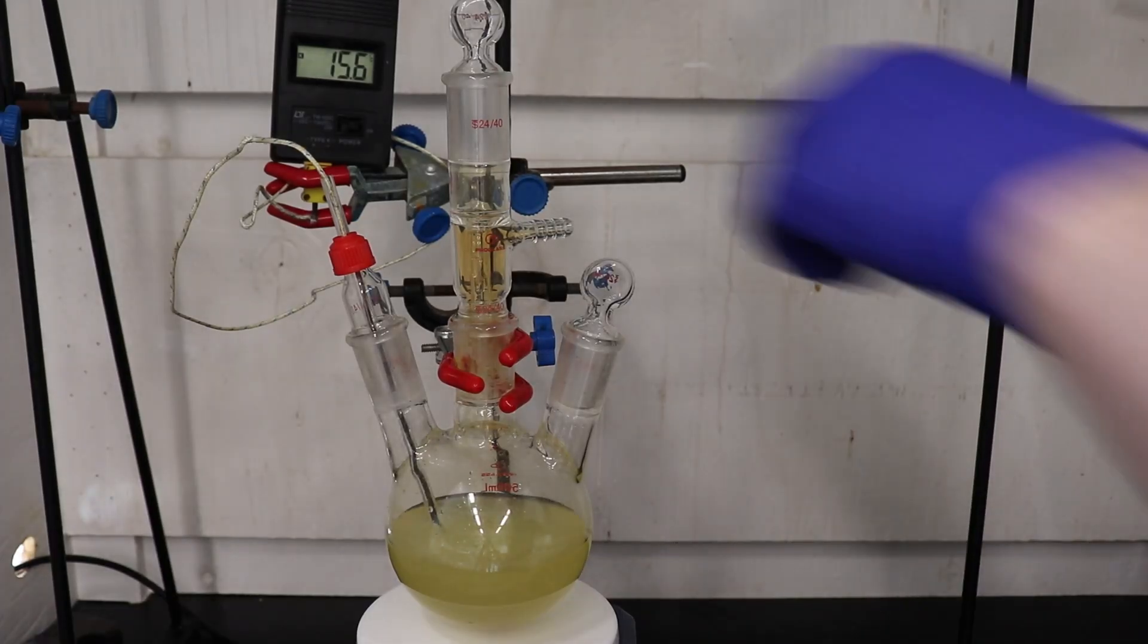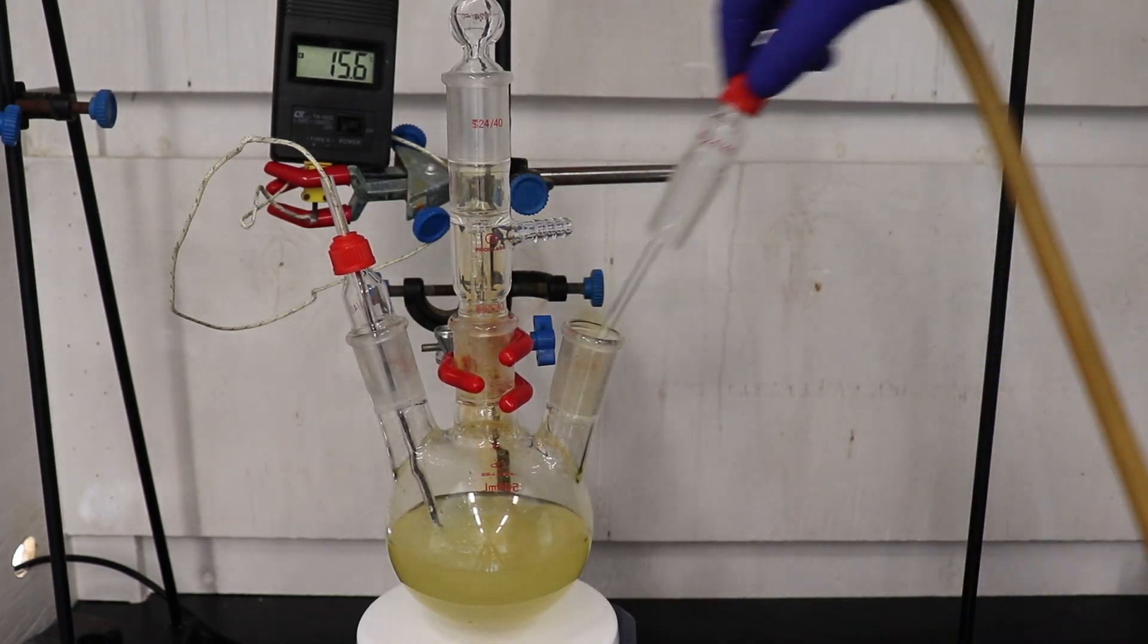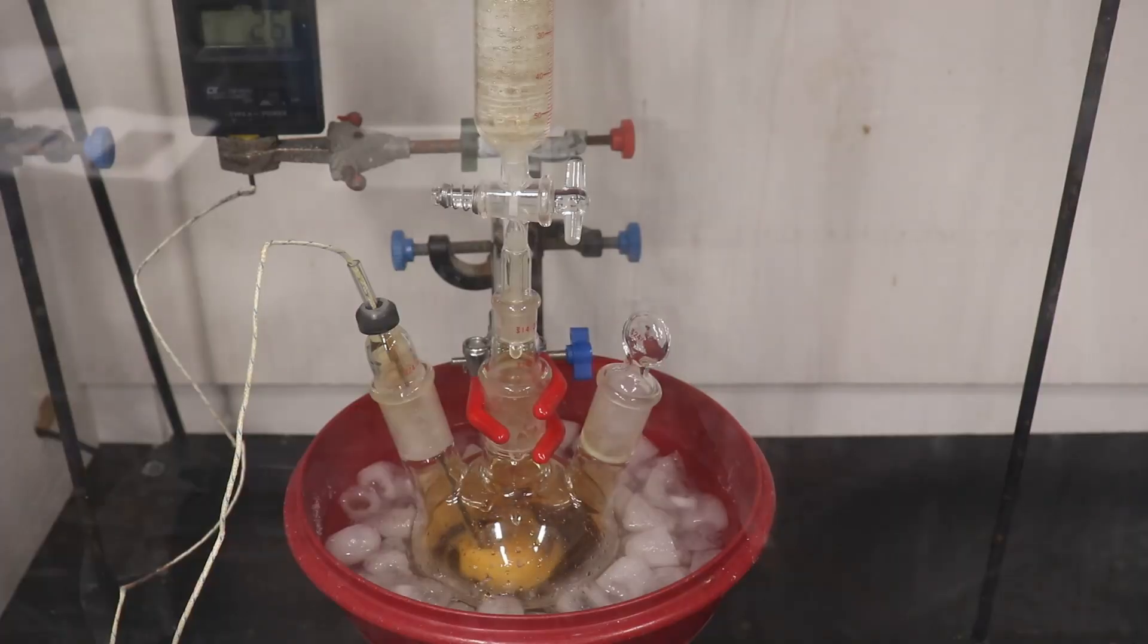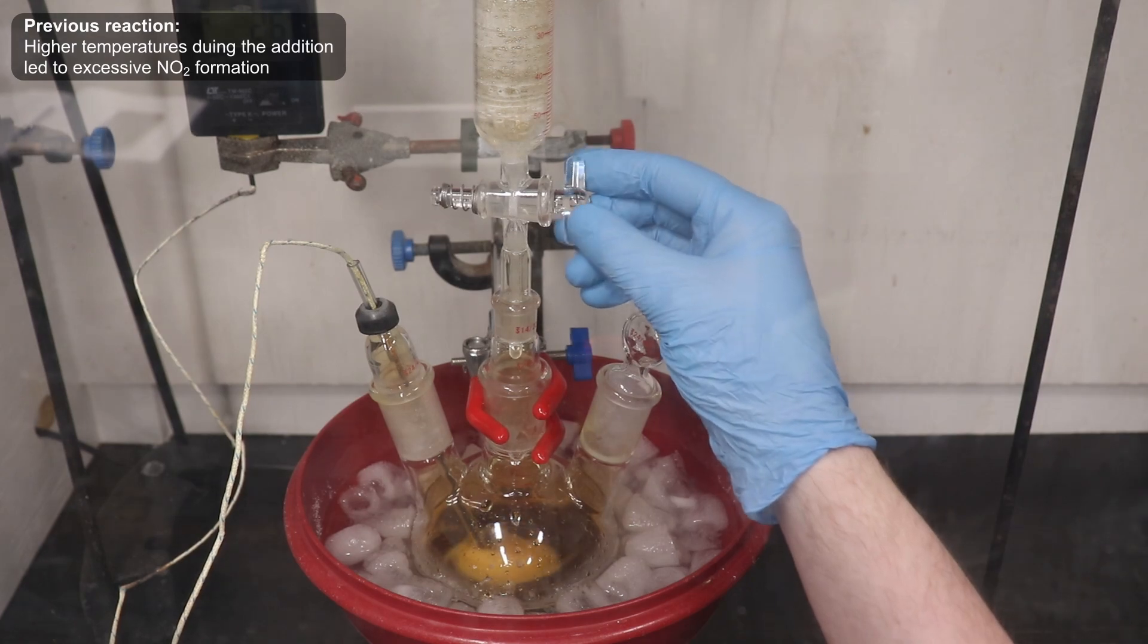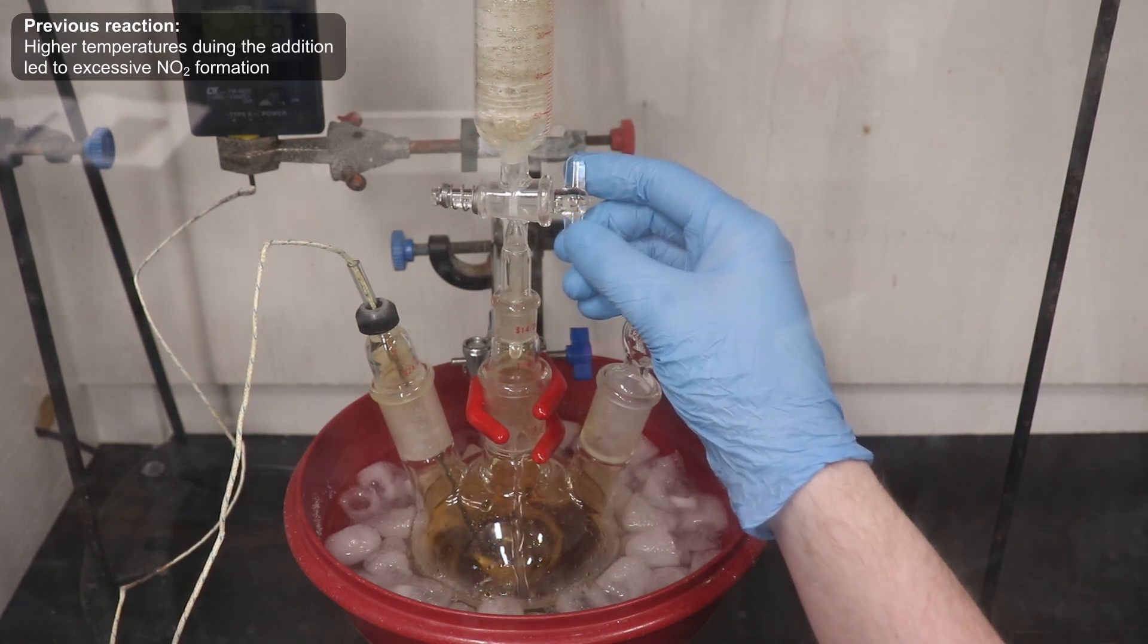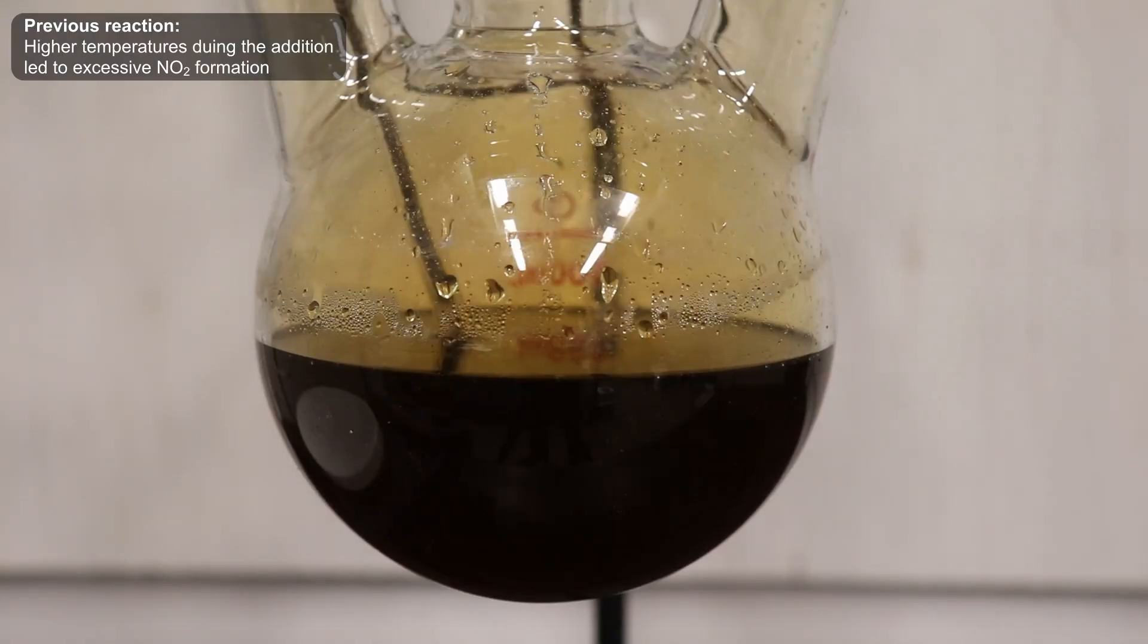The solution was visibly colored yellow from the presence of nitrogen dioxide. In a previous run of this reaction, where I had only used an ice water bath, there was significantly more dissolved nitrogen dioxide, to the point where the solution was almost black.